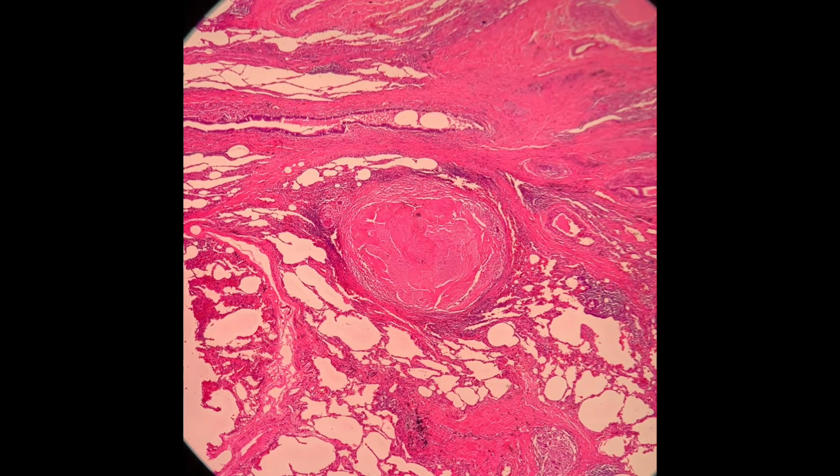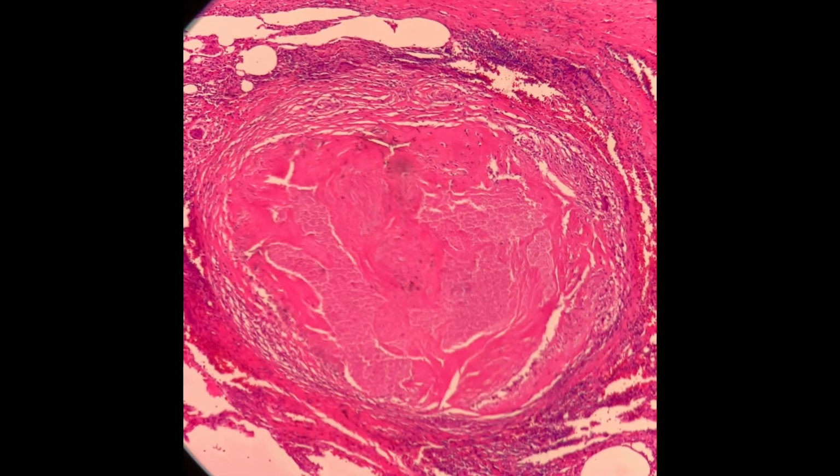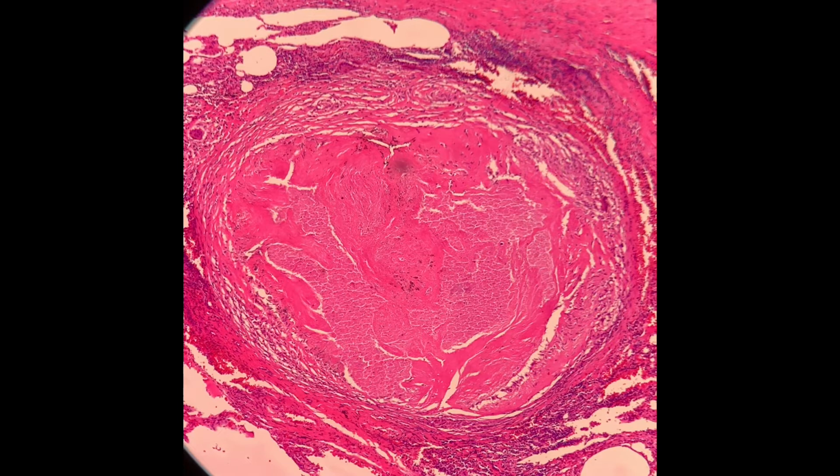It is encased by a rim of some sort of cells or tissue, and the outermost part of these nodules is the inflammatory cells, which at this time look like blackish or dark spots or specks surrounding these nodules. So we go to medium magnification, just to highlight what this lesion actually is. And you can see there is a lot of necrotic tissue or necrotic debris at the center of the nodules.